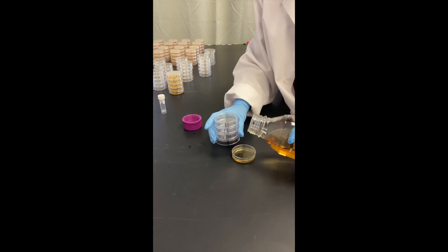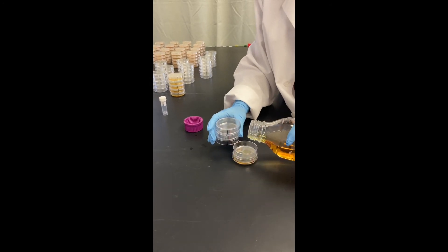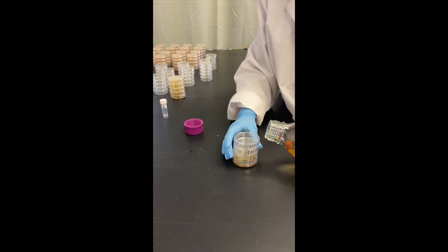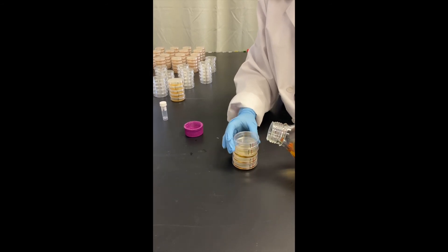Then we pour this into our petri dishes. As you can see in the back here, we usually pour many plates at one time.